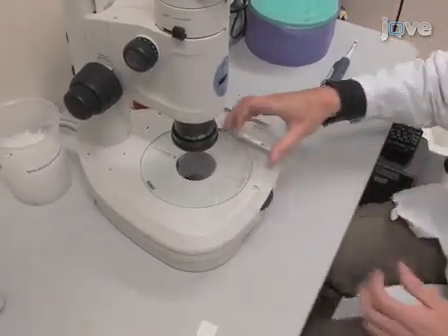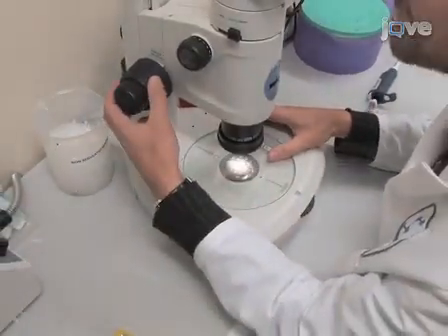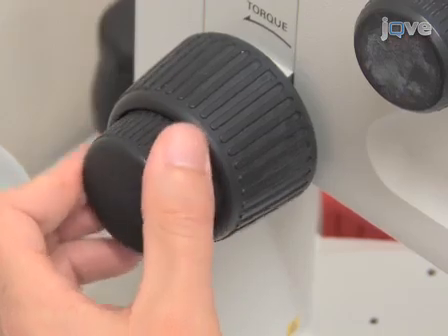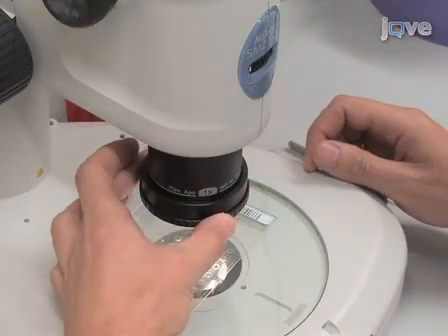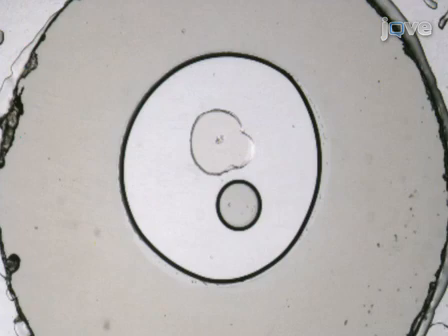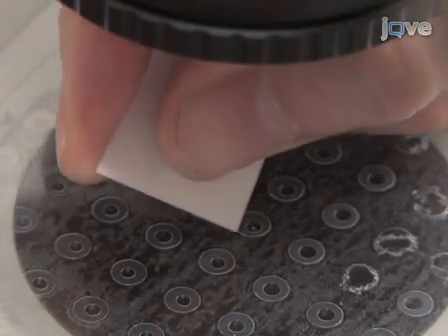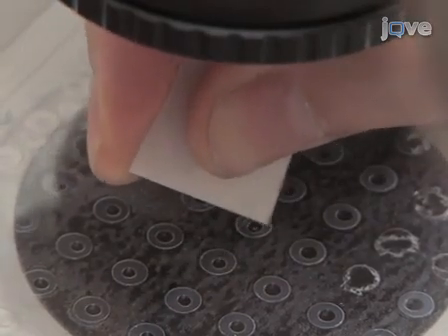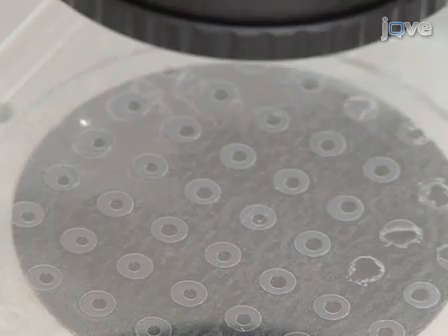Once the protein crystals have grown, place a plate with the crystals under a stereo microscope with variable zoom, equipped with a linear rotating polarizer and analyzer. Focus on the well of interest using a low power zoom so that the whole well is placed within the field of view. Score the cover slip glass in 4 strokes, making a square inside the well boundaries using a sharp corner of a ceramic capillary cutting stone.